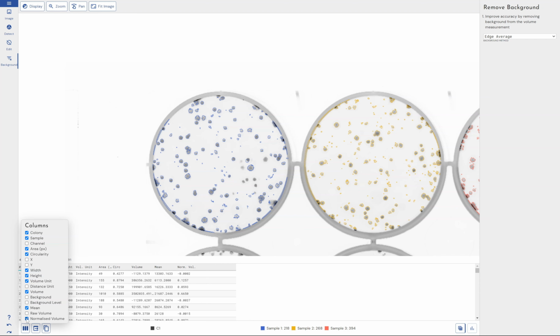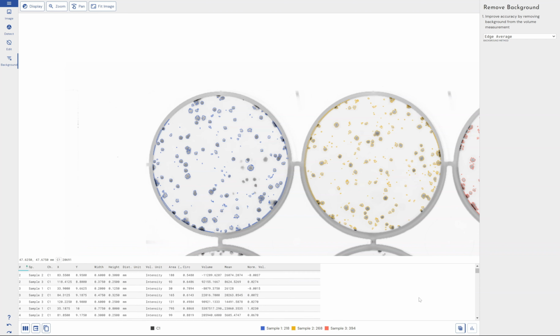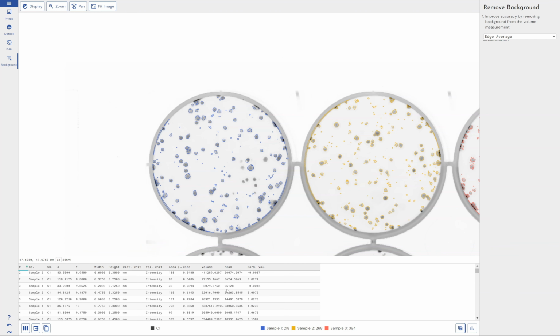We can change what measurements we display. So we are taking all of these different measurements, X, Y coordinates, distance unit, if you want to include that. Background level, we can take all of those measurements straight away using our automatic detection. And from here, we can export it to a CSV, or we can copy it to our clipboard and paste it in something else. So MATLAB, GraphPad, something like that, whatever you want to do further analysis on. Again, you can copy it to your clipboard and put it in Excel rather than export it to a CSV.